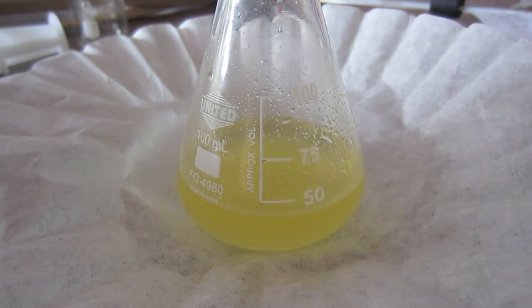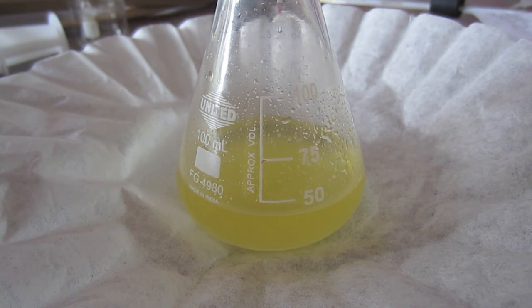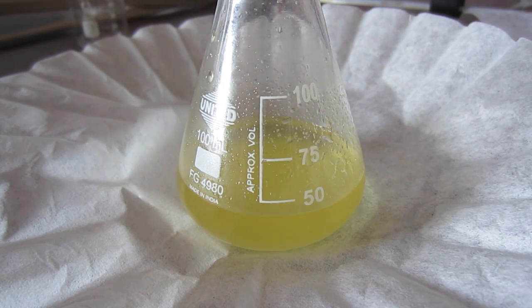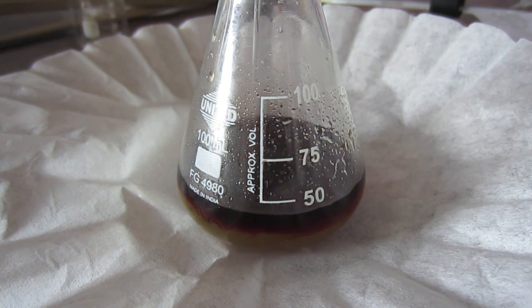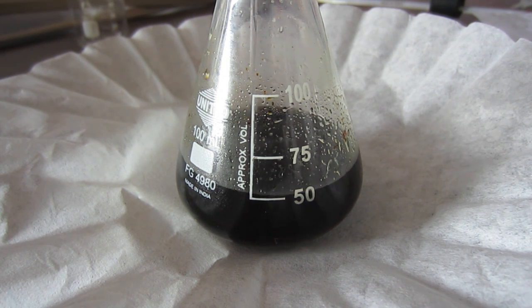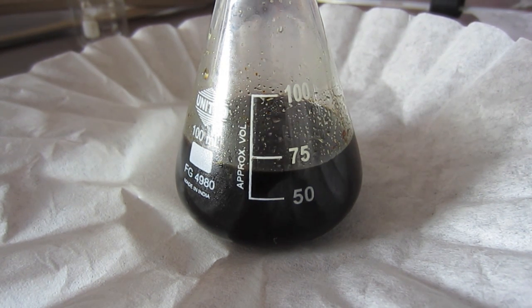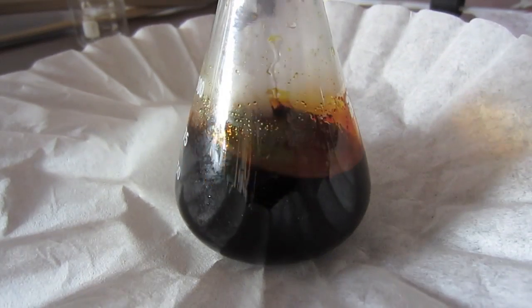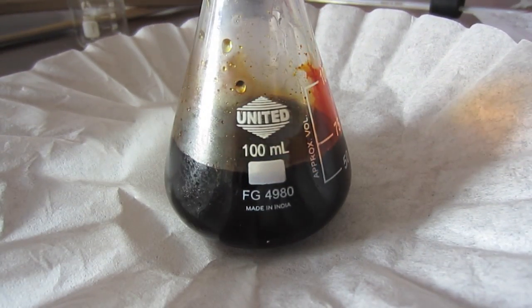You'll see a really nice color change when I add the bleach. Bleach is about to go in — it'll turn nice and dark. I'm not actually doing the bleach stoichiometrically; I can just see when the solution keeps getting lighter when I add more, as opposed to getting darker. So I'll get back to you when I finish.